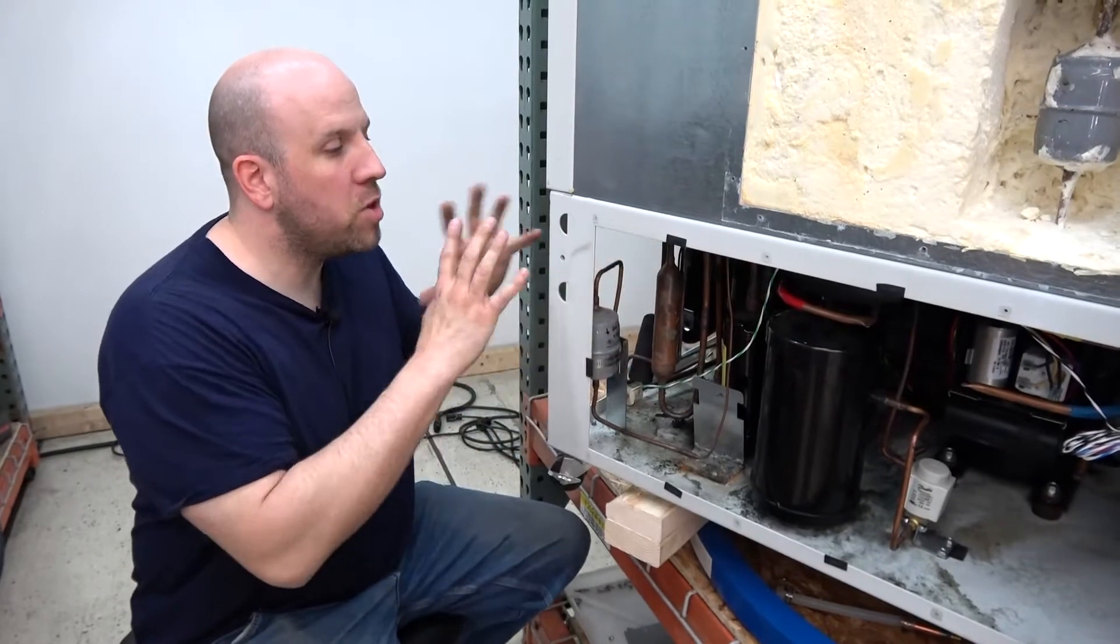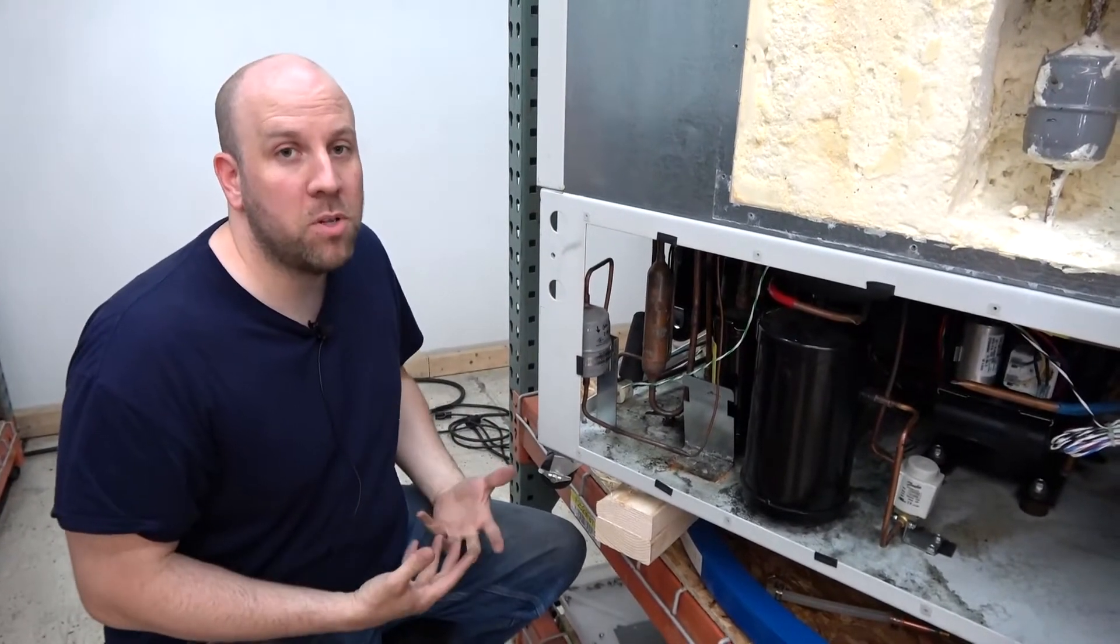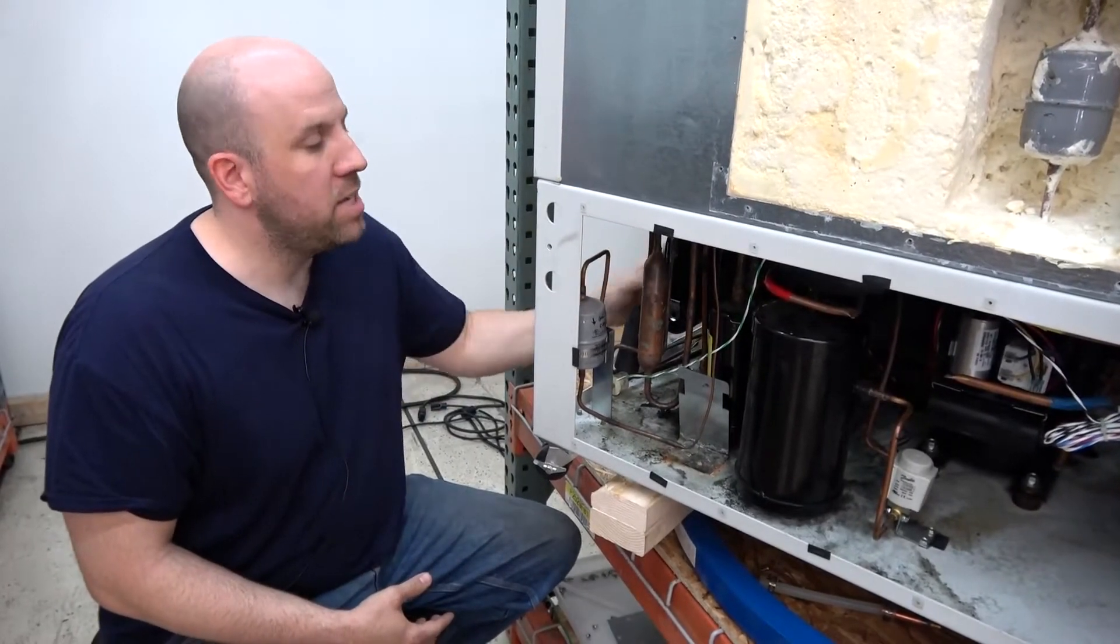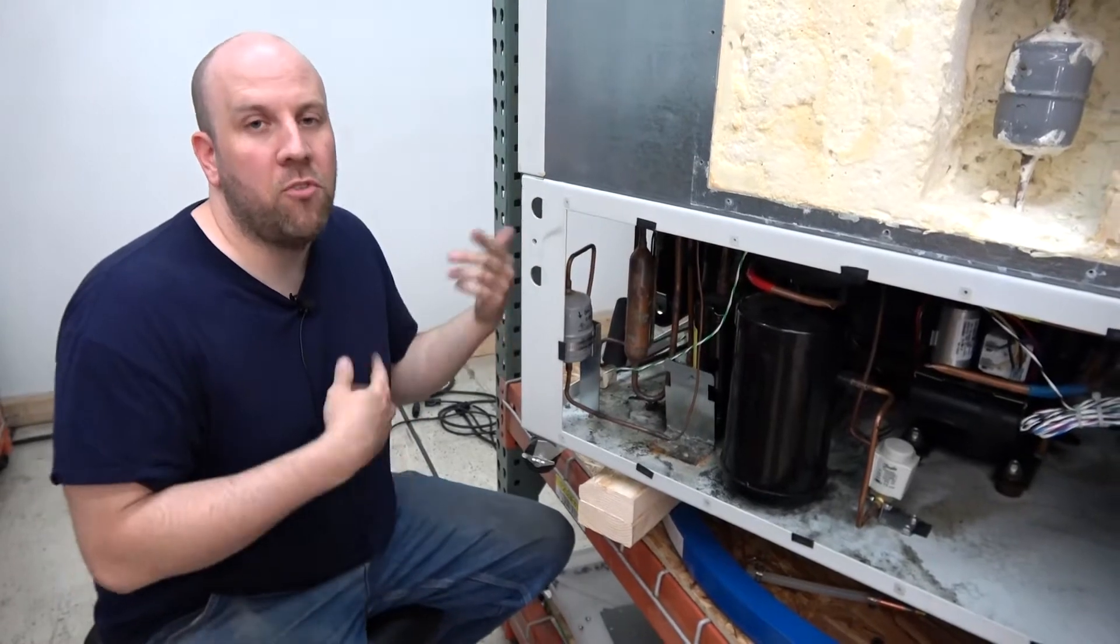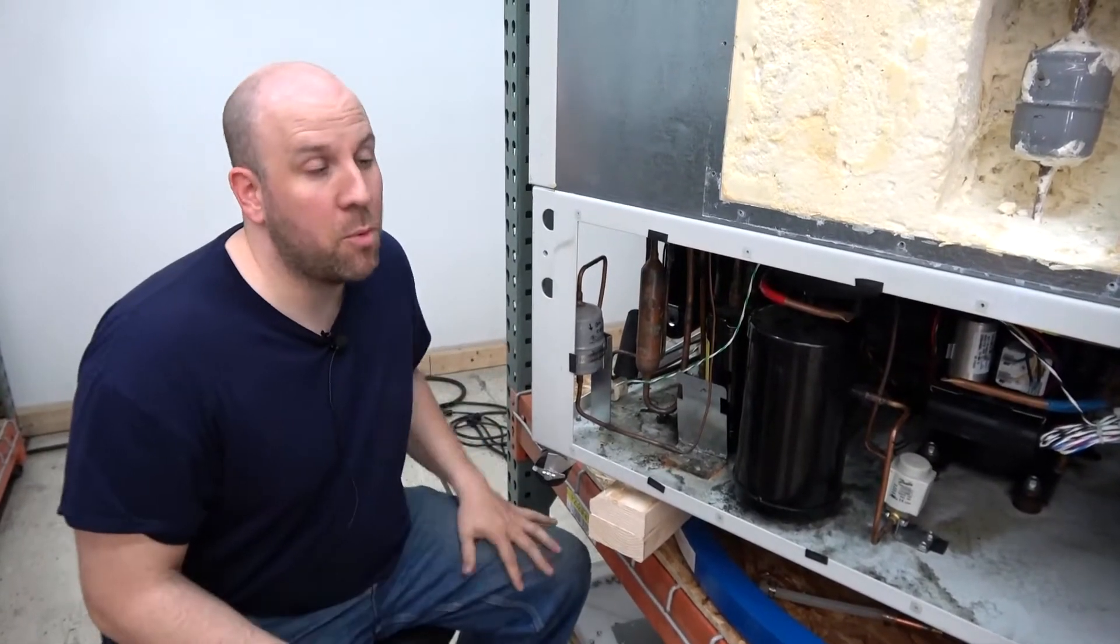So we thought we would try—what if we took all these components out, flushed all the lines with alcohol, all the components with alcohol. The only component we don't flush with alcohol is the compressor. We take that out, change the oil, flush it with oil a couple of times. And we found out that works really well.